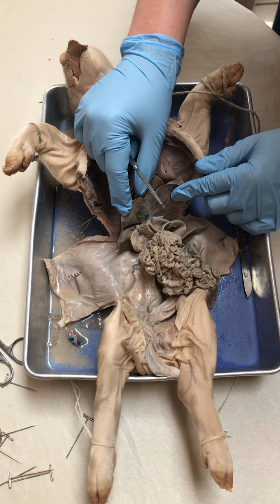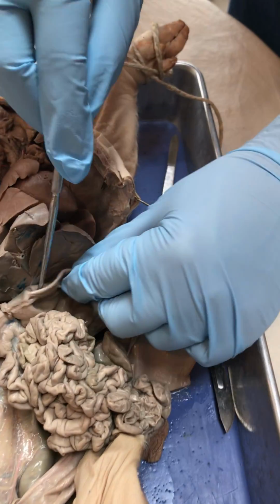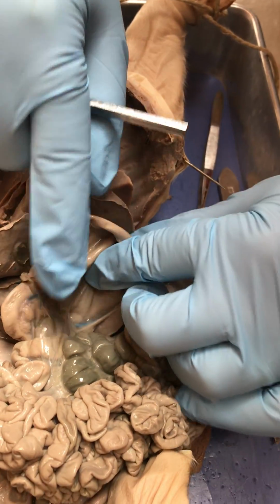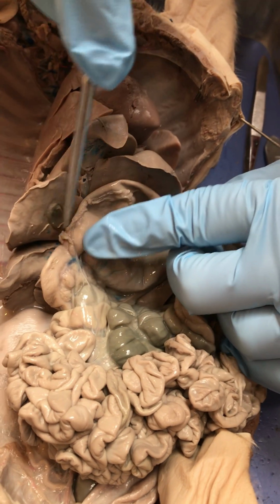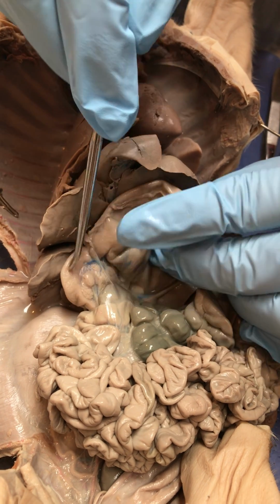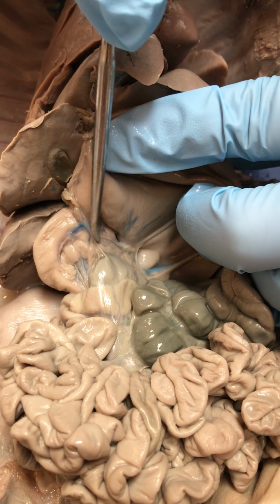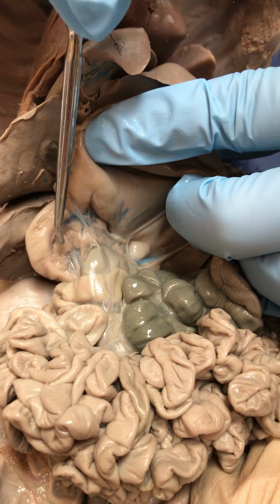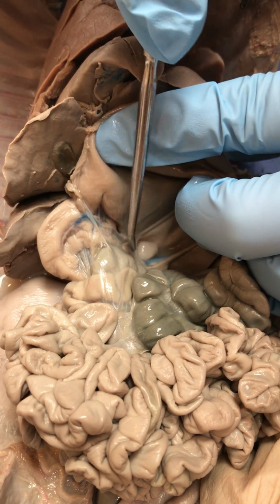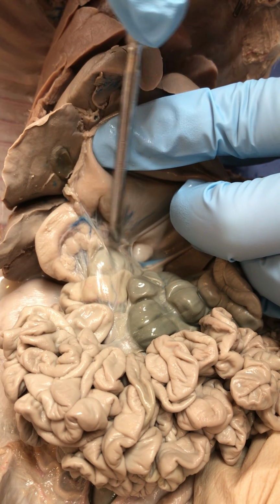All right, so once again, back to the abdominal cavity. What we see here is the spleen and the stomach. If I move the small and large intestines out of the way and look at the tube coming out of the stomach, remember this is the duodenum, the very first section of the small intestine. You see this very diffuse, spongy looking tissue, kind of long in that first loop of the small intestine. That's the pancreas. So that's actually the pancreas itself. Remember that makes insulin and glucagon as well as digestive juices.